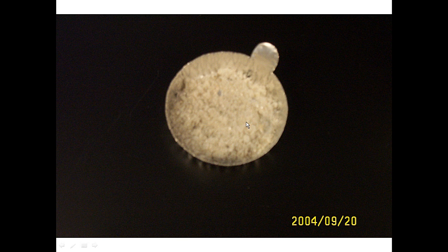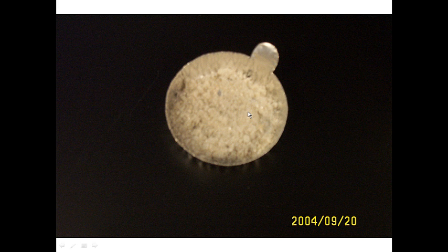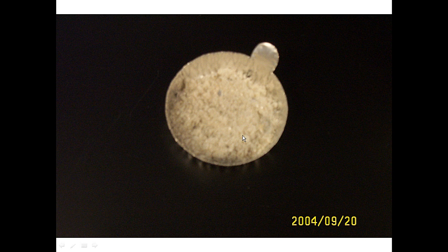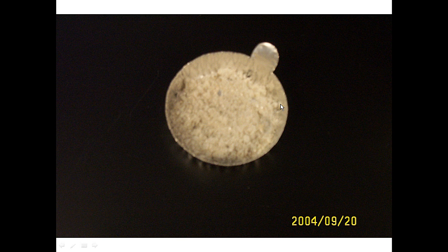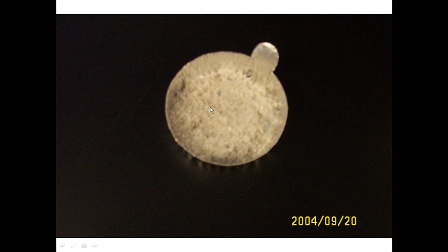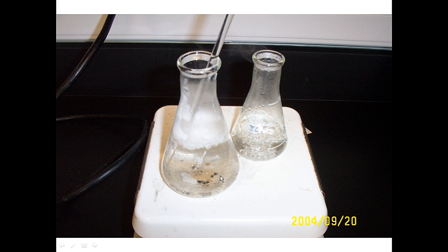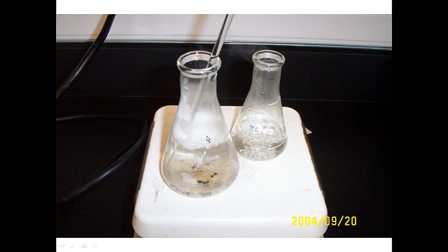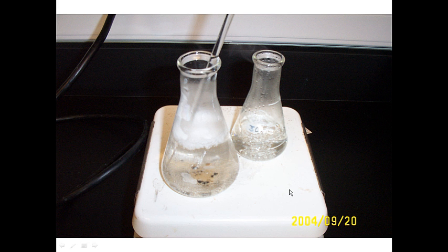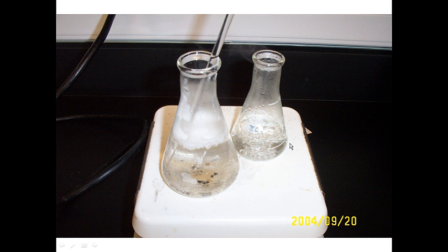We're going to start with crude acetanilide — a non-purified version that has been purchased and recycled from year to year. Impurities like charcoal, sand, and scraps of paper are added, so it will have a grayish-brown tinge. We're going to put the material into the appropriate amount of solvent and heat it directly on the hot plate. This begins to narrow down the solvent possibilities, since we normally don't heat flammable solvents on hot plates — so the solvent will be non-flammable.